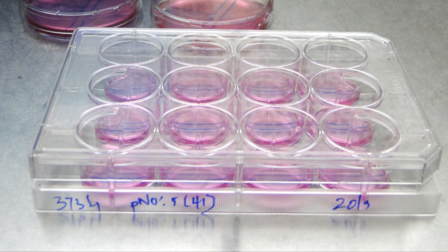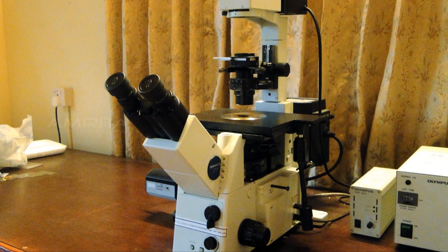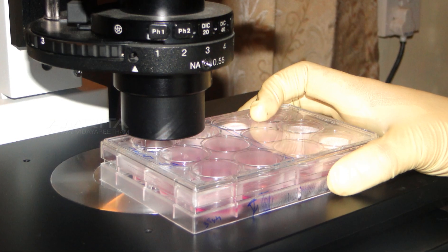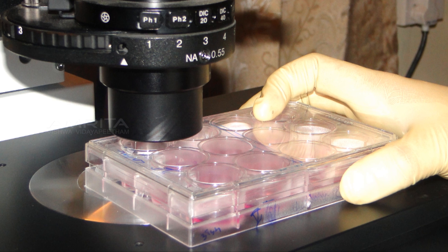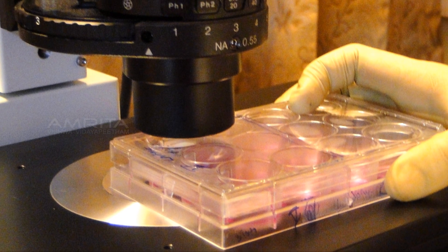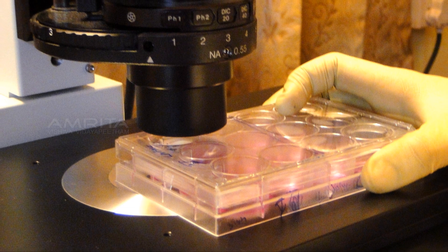Now take the 12 well plate and visualize each of the wells under phase contrast microscope connected to a computer installed with imaging software. Acquire first image of scratch at 0 hour. Images are obtained using 4x optics.